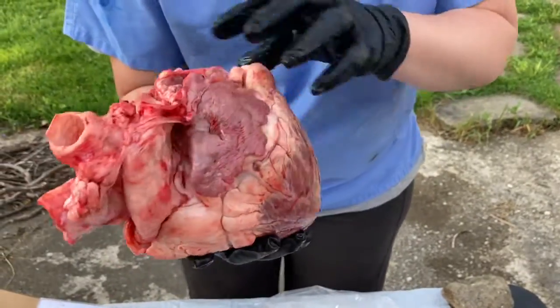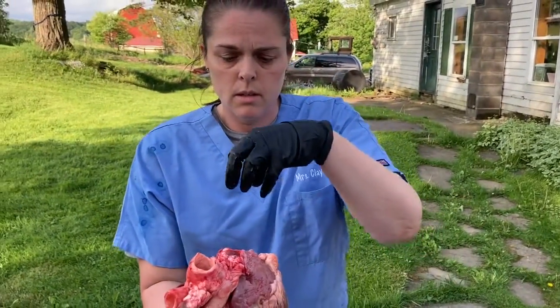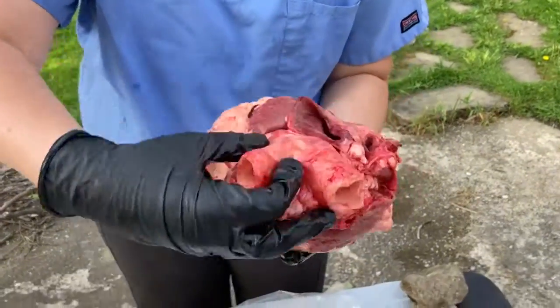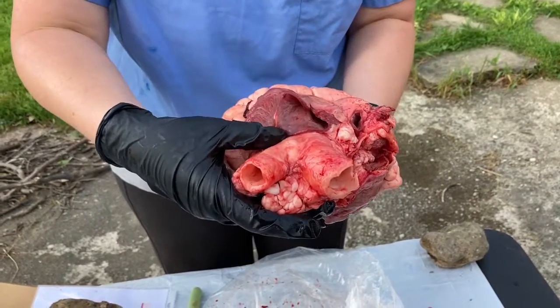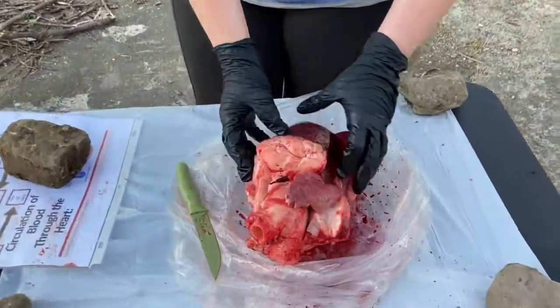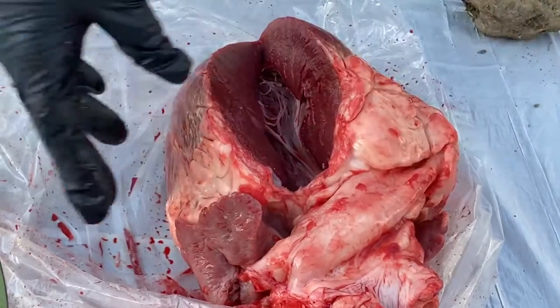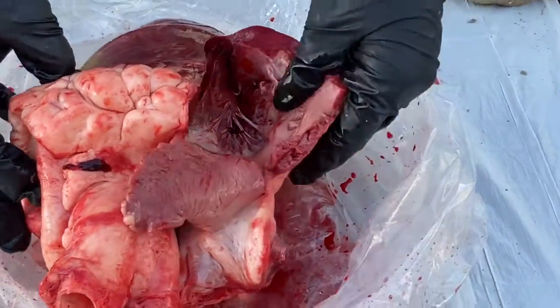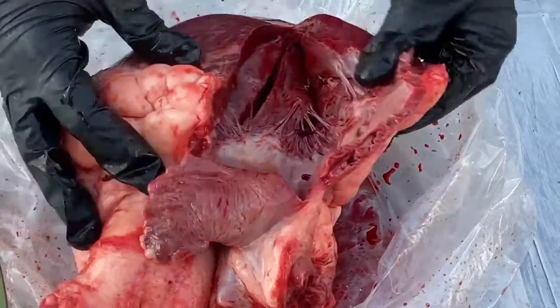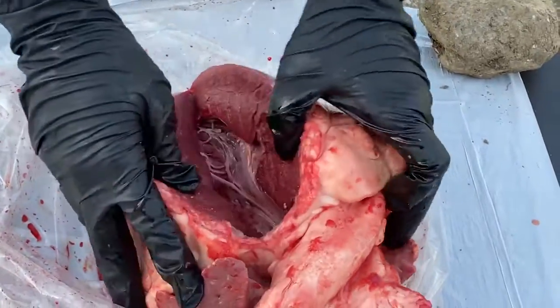Over on this side is where the blood is going to come from either lung into the left side of the heart. And this part right here, where it's got many different parts to it, is the aorta. I did go ahead and start cutting into this thing. We didn't really talk about different types of muscle in class, but maybe in biology or life science you talked about smooth, skeletal, and cardiac muscle. This is where your cardiac muscle is, and you can see how thick it is. Again, this needs to pump the blood throughout the body.